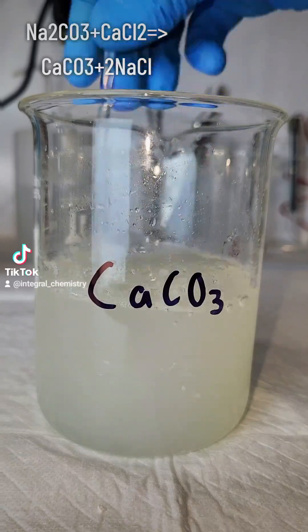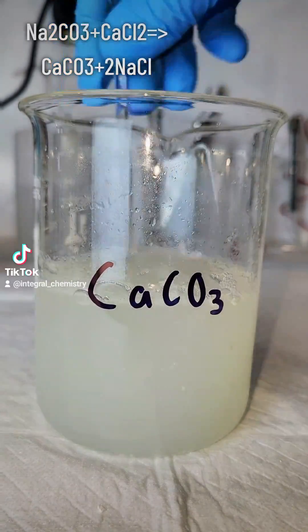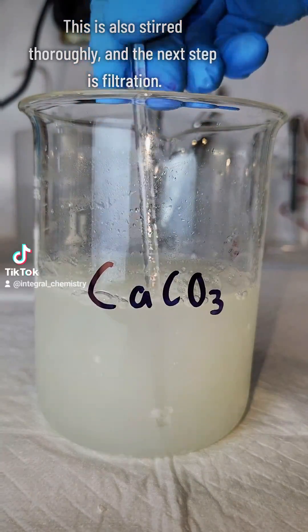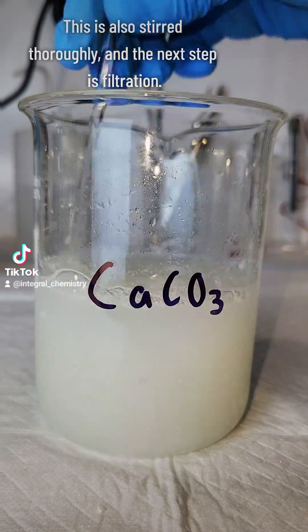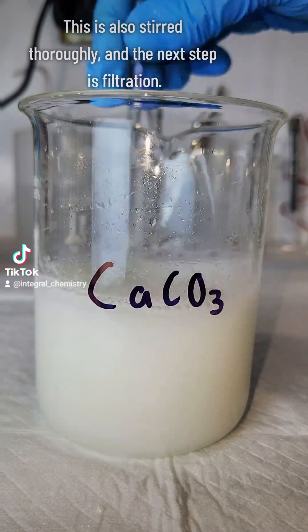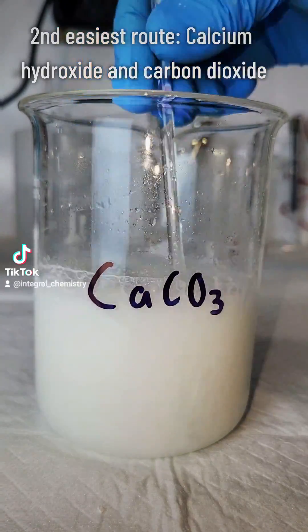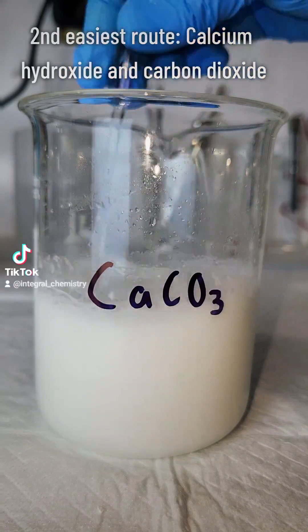The byproduct of both of these reactions is plain salt water, which I then filter away in the next step. On a side note, most calcium carbonate made industrially is made by bubbling CO2 through calcium hydroxide, but that's not a very easy thing to do at home.